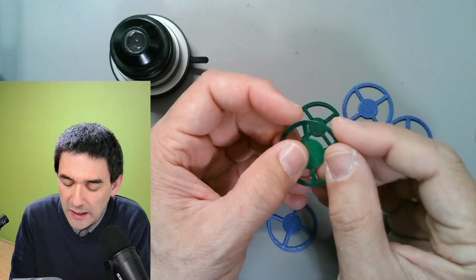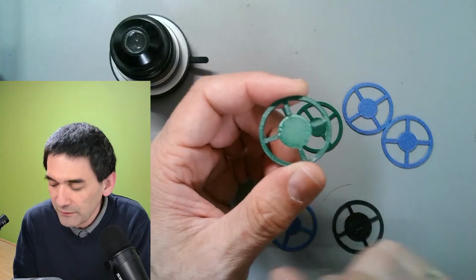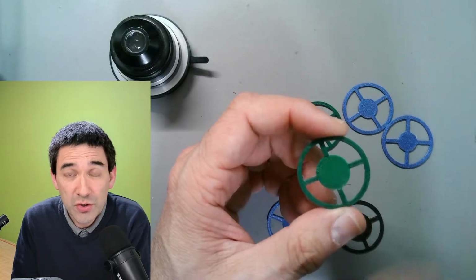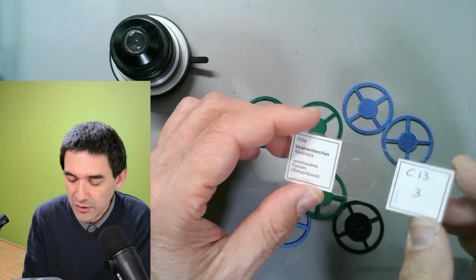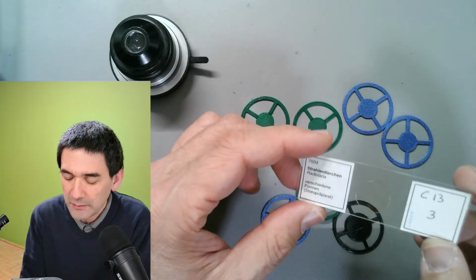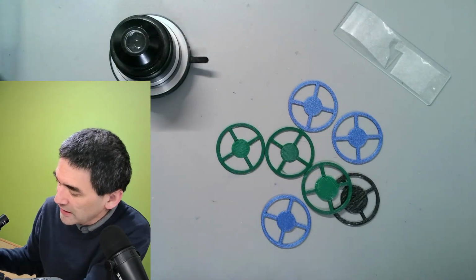What I would like to do now is show you a very nice slide containing radiolarians, because this gives a very strong effect. I'm going to change the slide. These are radiolarians; they contain a shell made of silica. They're pretty nice looking, and they're always my go-to specimen if I want to demonstrate dark field or oblique illumination or Rheinberg illumination.